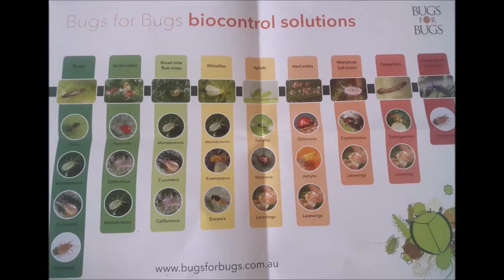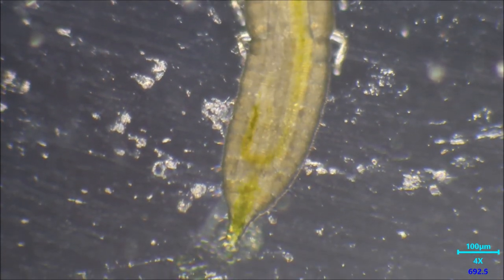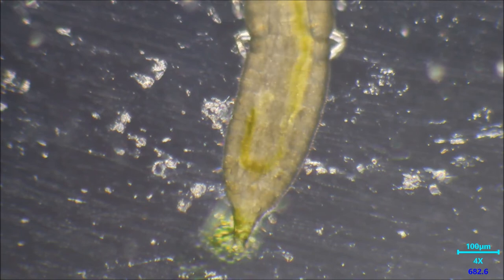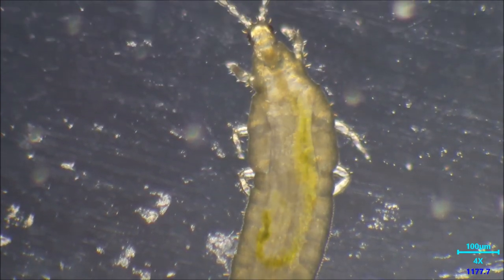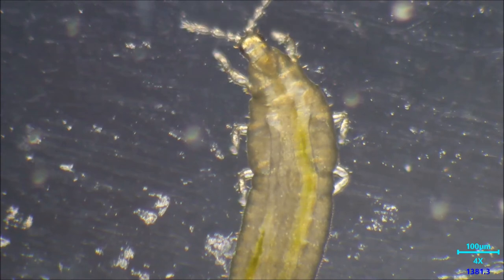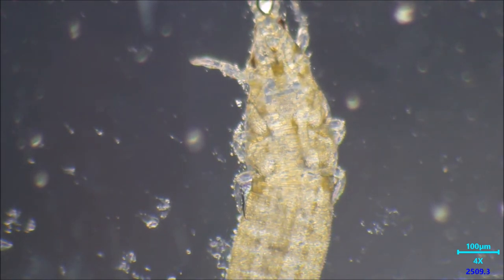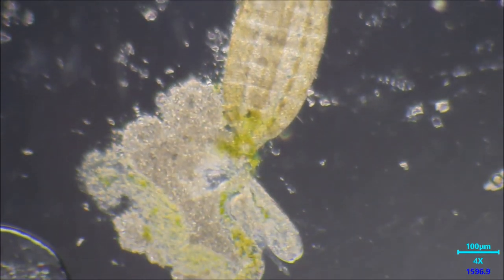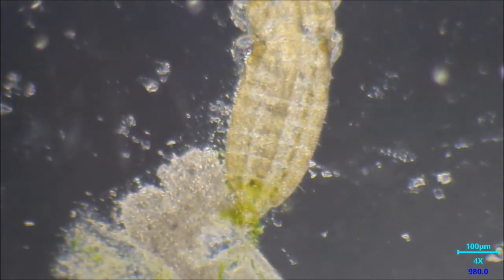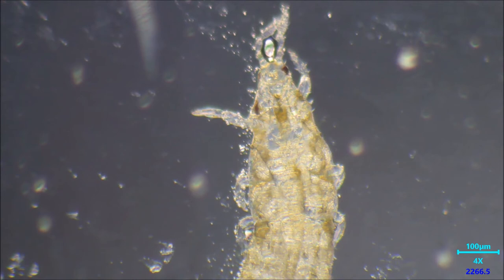Now the RO water experiment — look at that, it's going to shoot itself! When cells are placed in a hypotonic solution like alkaline RO water, water enters the cell in response to the osmotic gradient. This influx causes the cell to swell, and if the concentration gradient is steep, the cell may burst — a process known as lysis. That's exactly what happened here. It killed it pretty fast, but it's not very practical: you can't easily dip a whole plant upside down in water for 45 seconds.